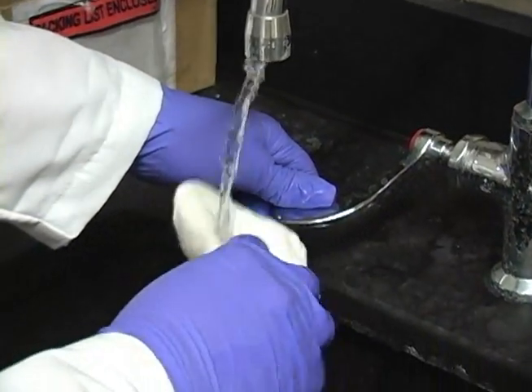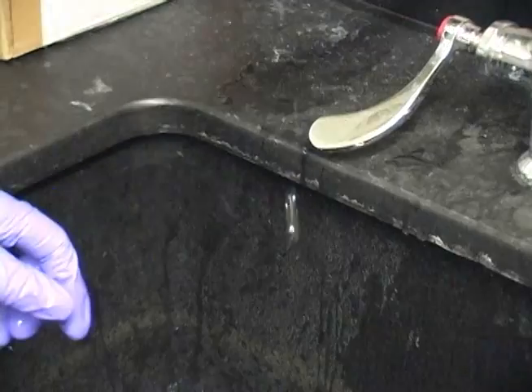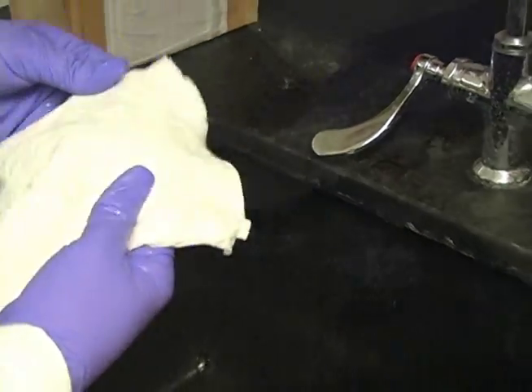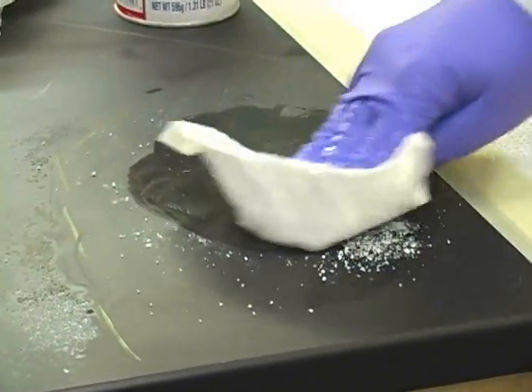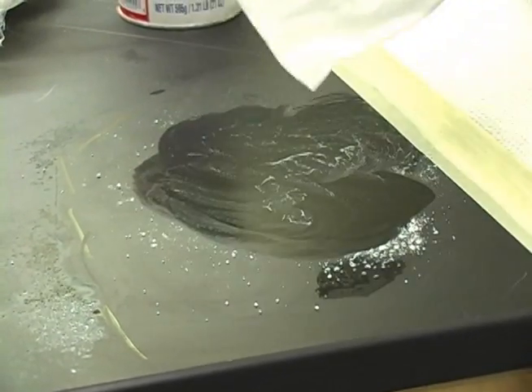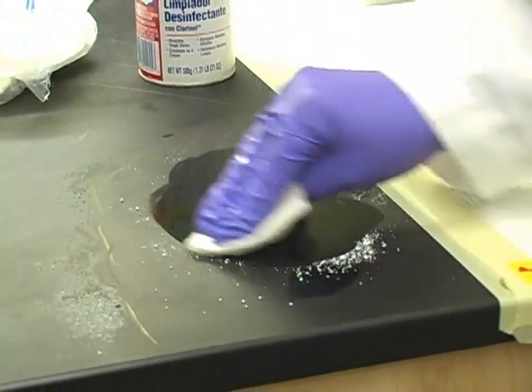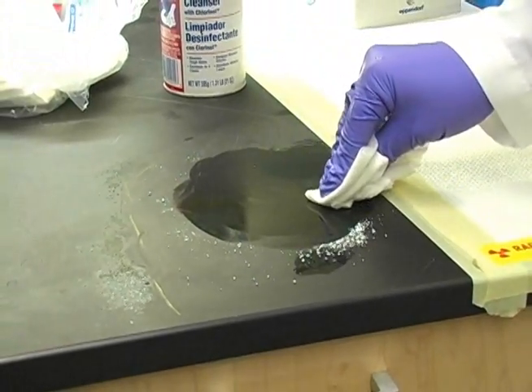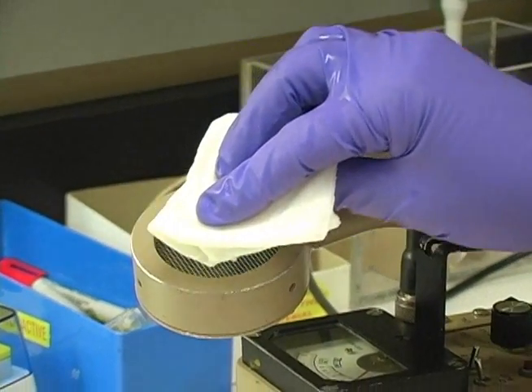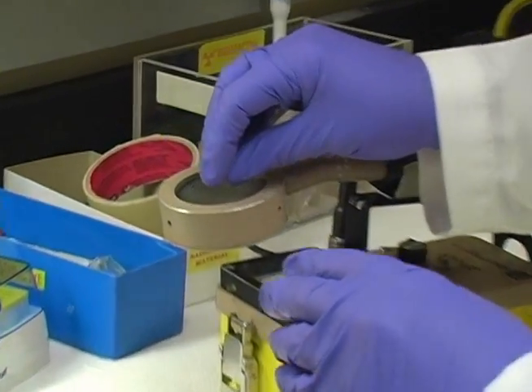That's fine too — wet down a towel and rub over the area to see if we can get anything up that way. Just make sure you take your time and do a good job cleaning. Frequently check to see if the contamination is coming up. If no more contamination comes up, then you go to the next area.